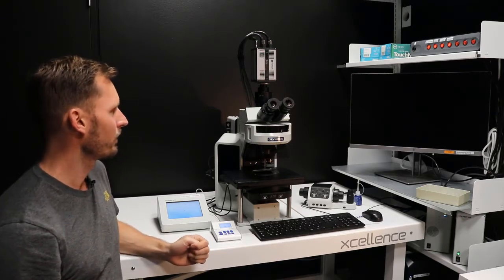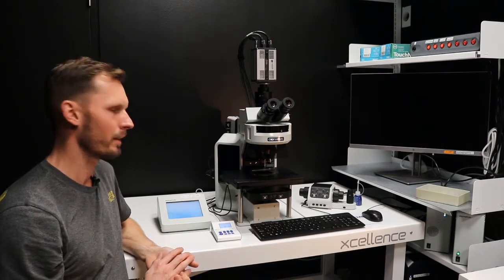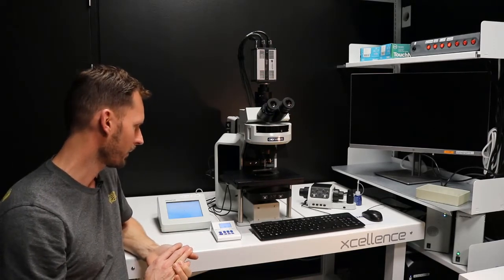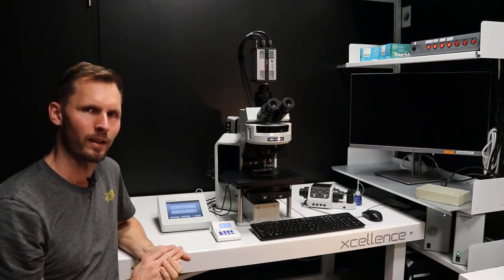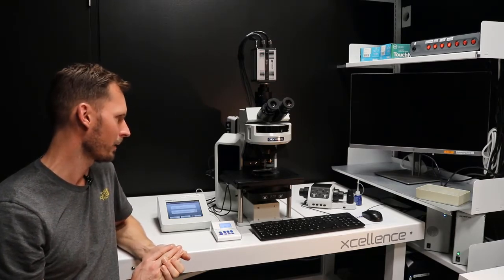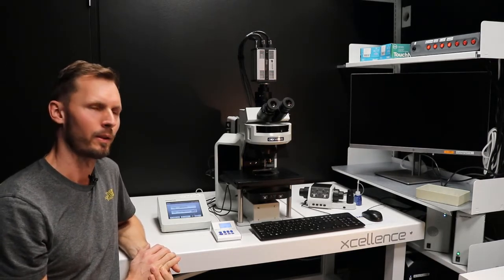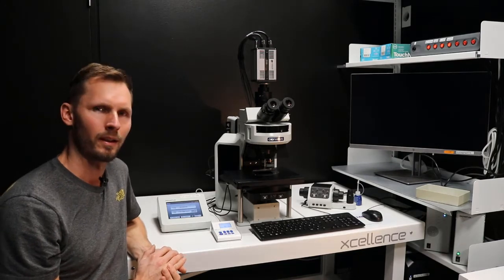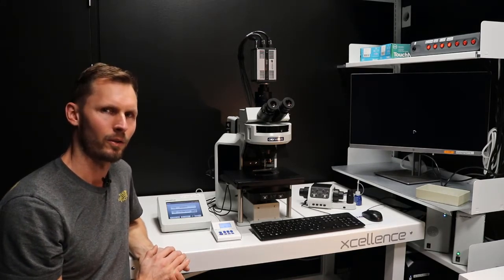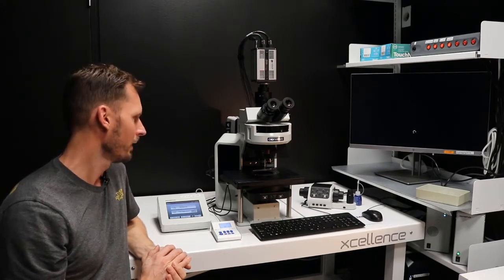And I can introduce you to the components. We have in this microscope four lenses right now, so it's 10, 20, 40 and 60x objectives, and actually also 100x objectives, so we can cover the whole range. And the dyes we can analyze are Hoechst, FITC, Cy3 and Cy5.